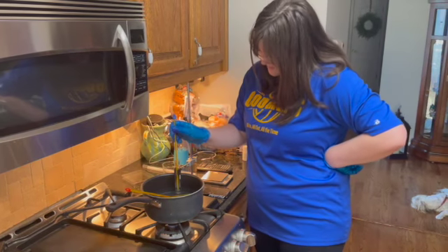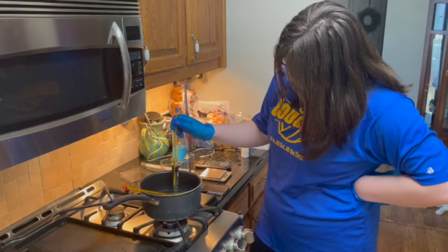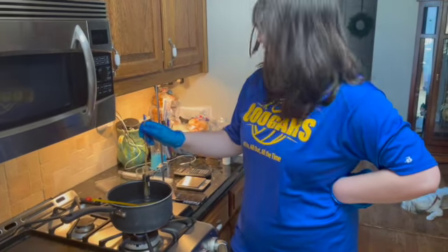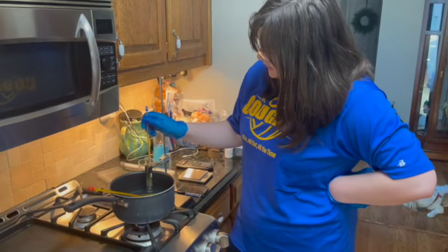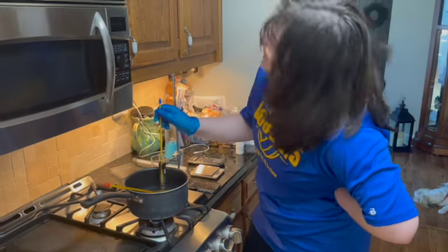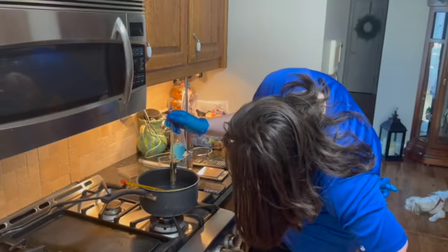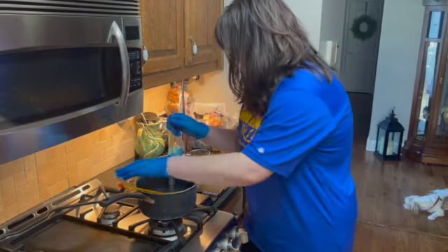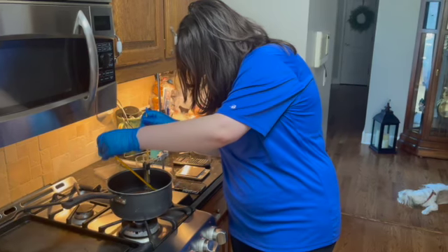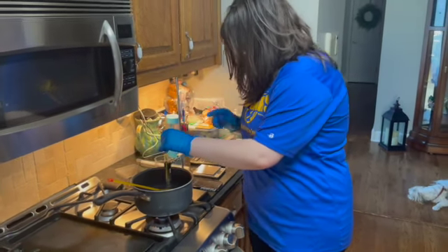So yeah, we are getting pretty close. It's at 16 minutes and 45 seconds right now, so we're getting pretty close to that 17-minute mark. Looking back at our solvent temperature, it is at 54, pretty close to 55, and our hot bath is at 55 degrees Celsius.